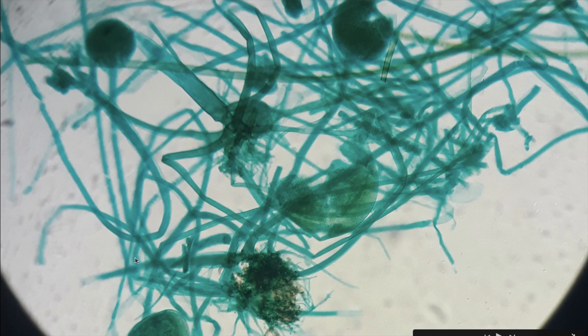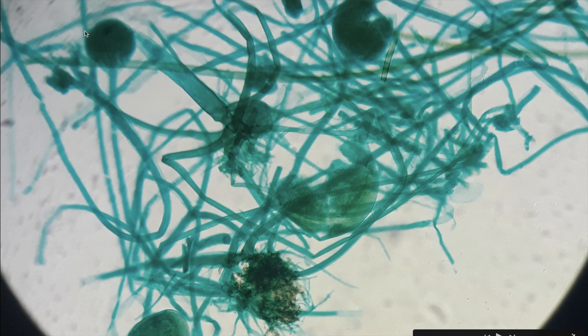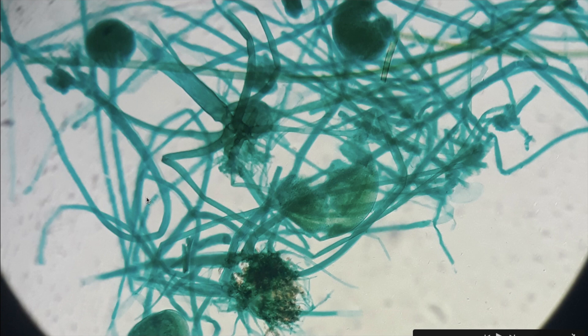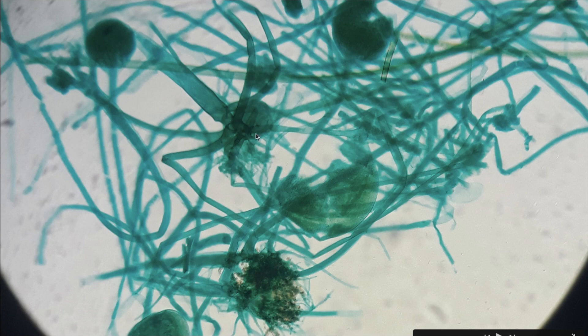Sporangiophores lift the sporangium to increase exposure to wind, water, and animals, helping in the transmission of the fungi.